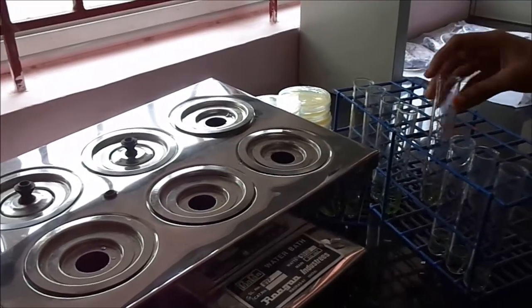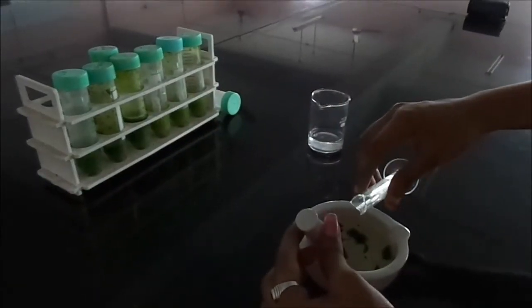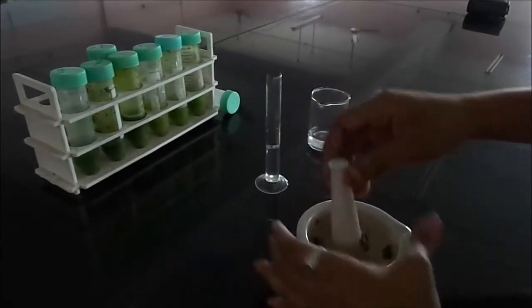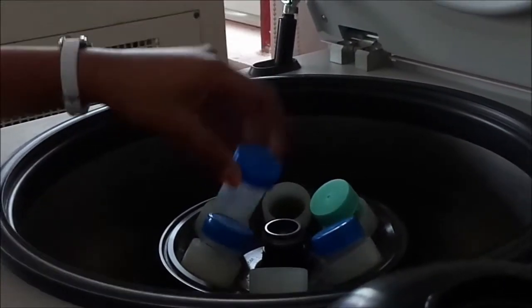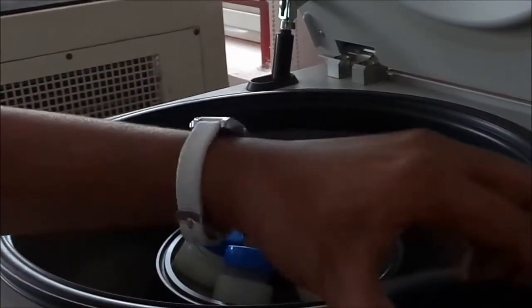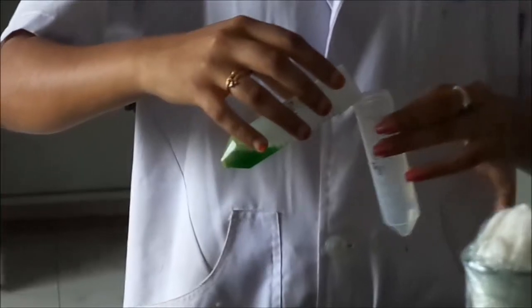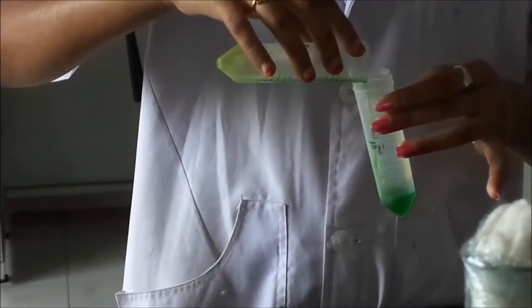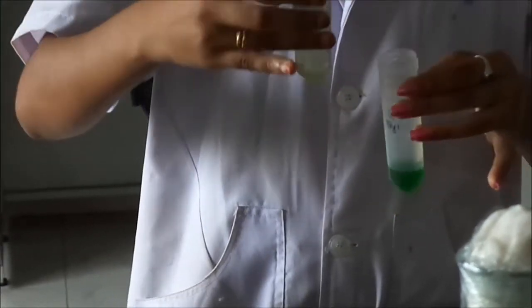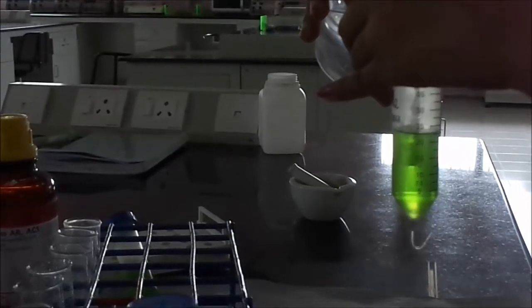After 30 minutes, the tubes are taken out of the water bath. The leaf samples are macerated well with 10 ml of 80% acetone in a pestle and mortar. The macerated samples are then transferred to centrifuge tubes and kept for centrifugation. Centrifugation is carried out at 3000 rpm for 10 minutes. After centrifugation, the tubes are carefully removed without disturbing the contents. The supernatant is collected and the pellet formed is discarded.